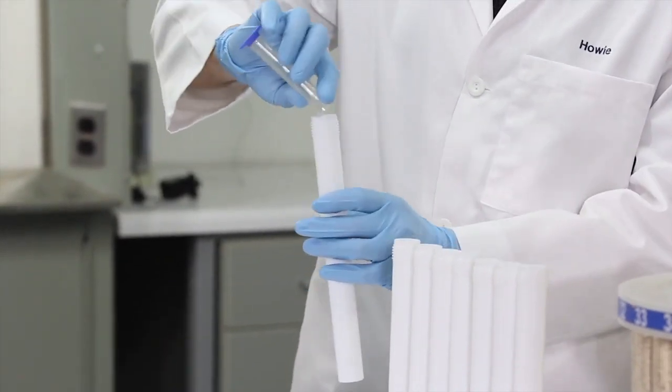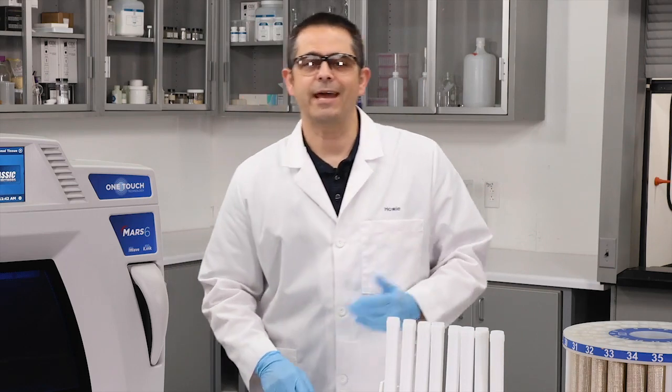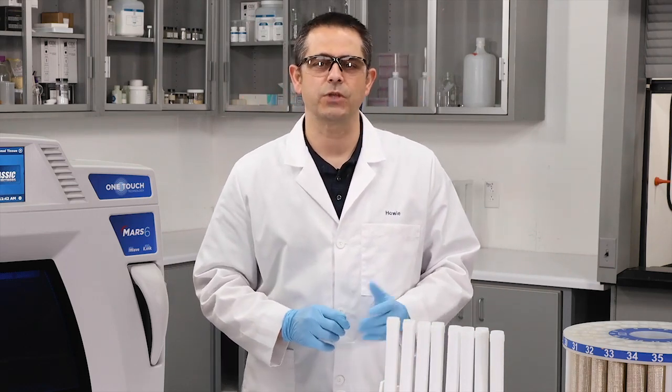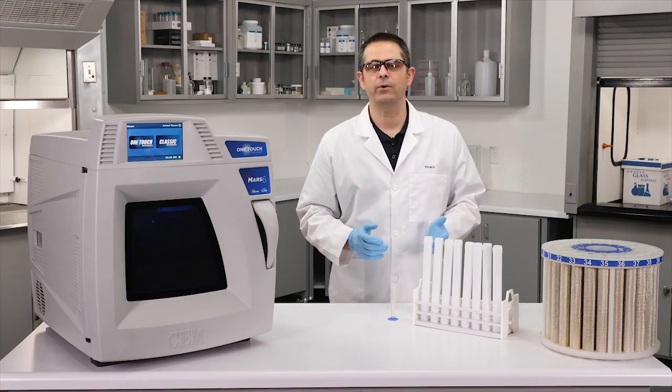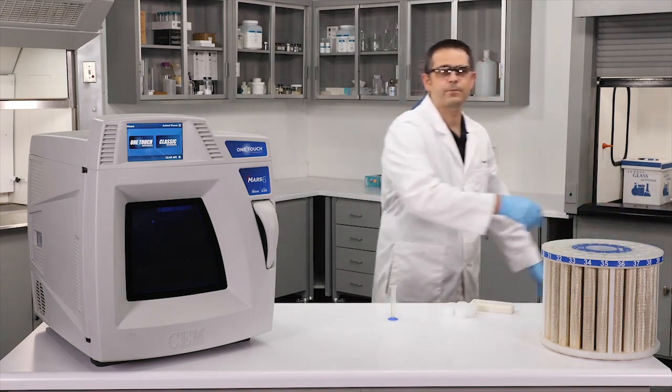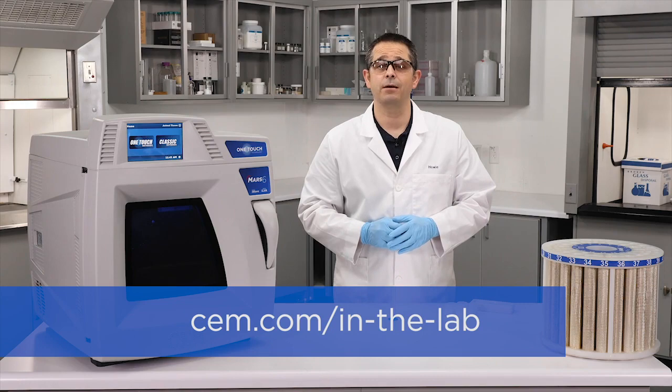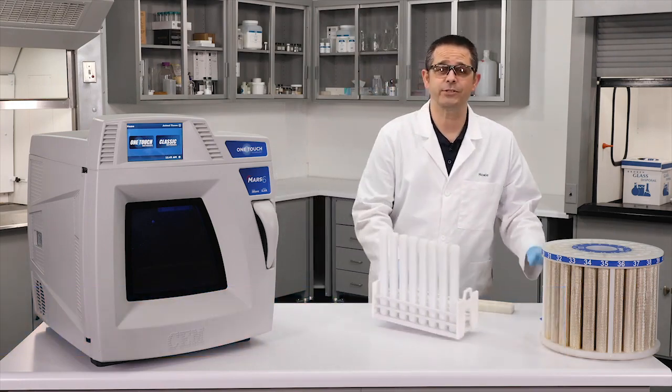And sample number eight. Now that the samples are prepped and acid has been added, we'll need to pre-digest the samples by leaving the vessels uncapped in a fume hood for 15 to 20 minutes, allowing any initial reaction to subside. For more information on how to perform a pre-digestion and other tips and tricks, visit us at CEM.com. In the lab... wow man, I could get used to this kind of service.